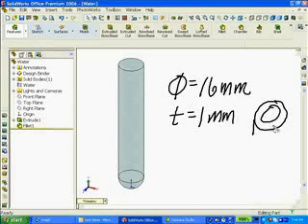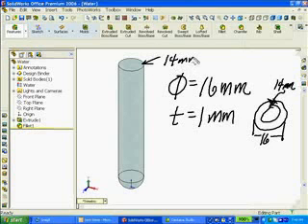With 16 millimeters of my outside diameter, my inside diameter here of the ring of the test tube would have to be 14 millimeters. So the water that I model has a diameter of 14 millimeters. Remember subtracting thickness from both sides on the left and on the right.